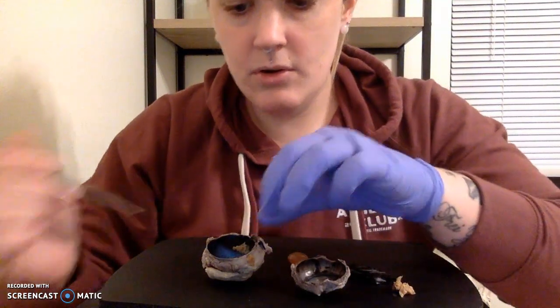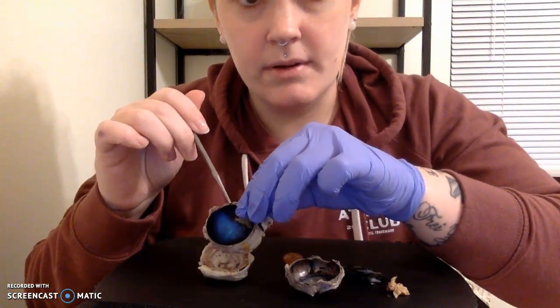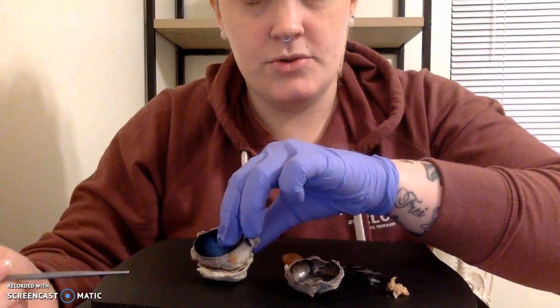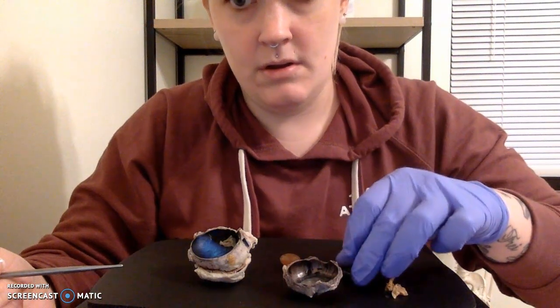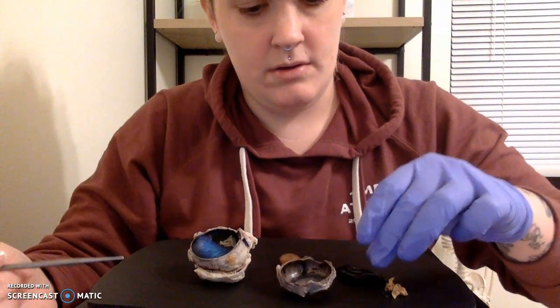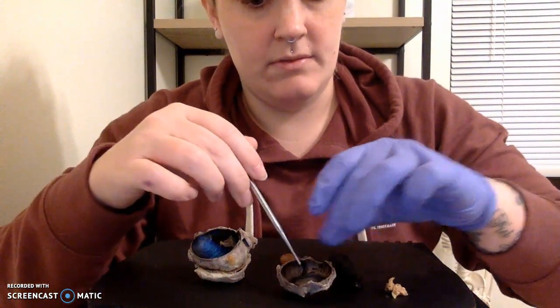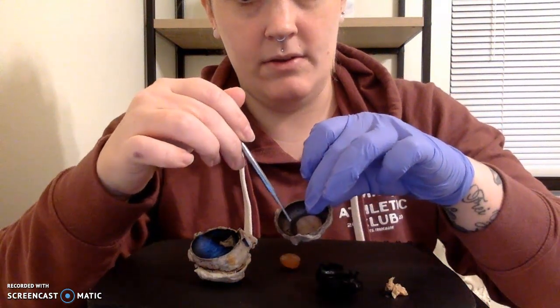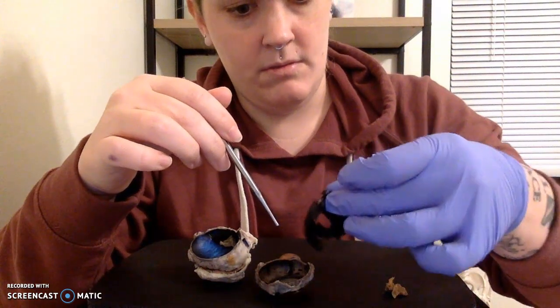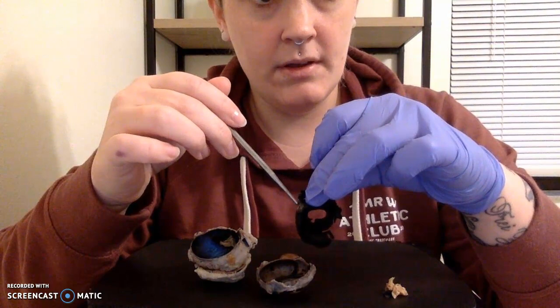Next, I want to show, and I hope you can see, our choroid that's going to be at the very edge right about here. And then I want to show you our retina. So if I can get in here. So our retina is going to sit right back here. You can see that our retina has been partially removed here. It's this dark feature that's here.